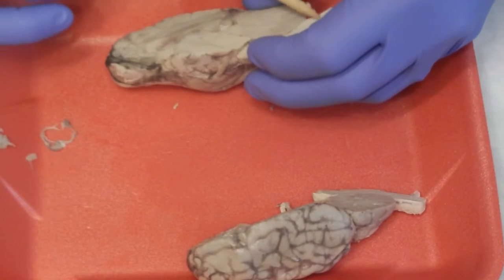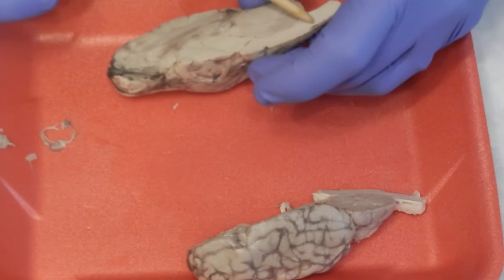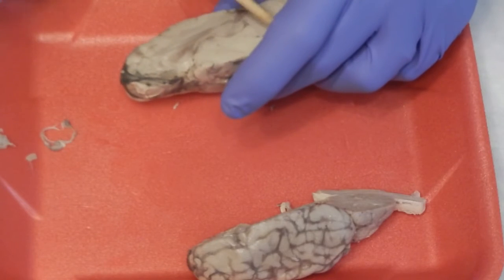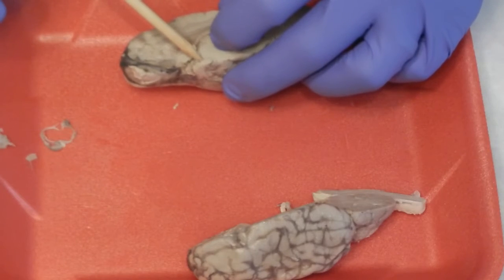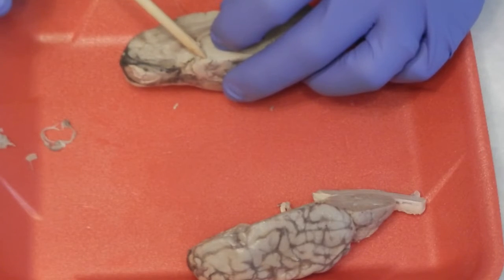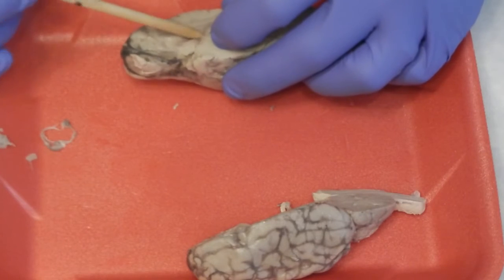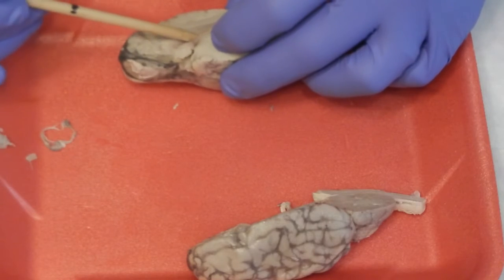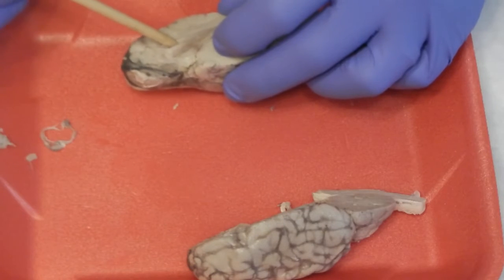So what we have here, if we come up and follow the brain, we have the spinal cord that goes to the medulla, which has this little indentation that indicates that this area is going to be the pons, which will come up into the midbrain. What we have here is the optic nerve, or the optic chiasm, that's been dissected and transected across. If we look in here, what we'll find is a little cavern, and then we have another little cavern up in this area.